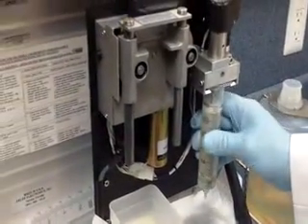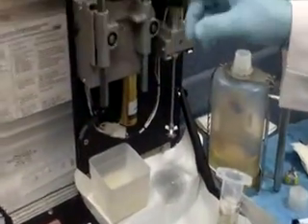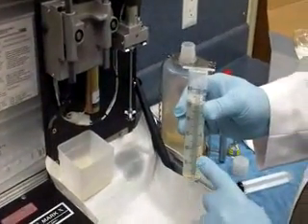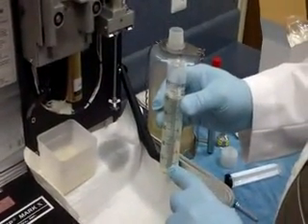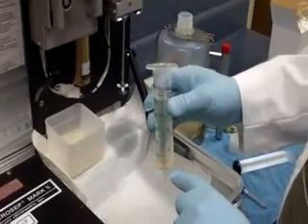This time, remove the syringe from the emulsifier. The syringe drive will go up to its full length. The reason we clean the sample is we're not actually cleaning the fuel — we're cleaning the syringe of any contaminants that may have been given there by the manufacturer.